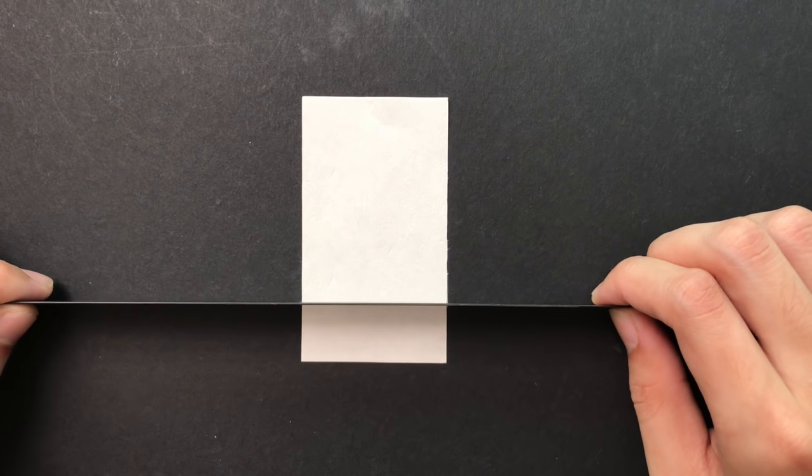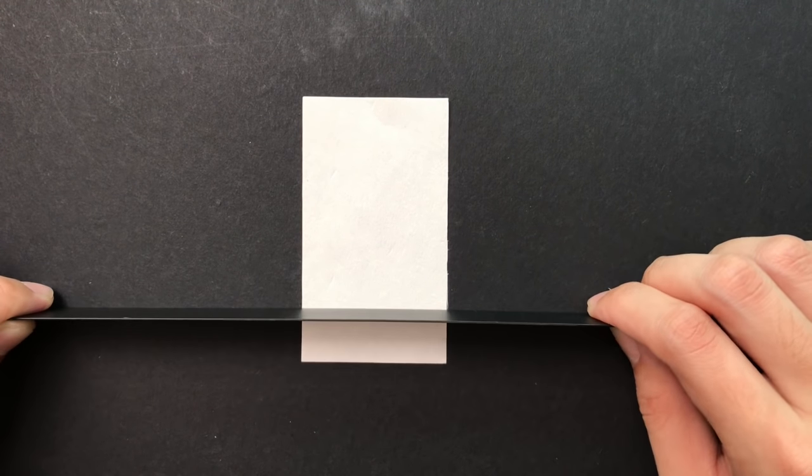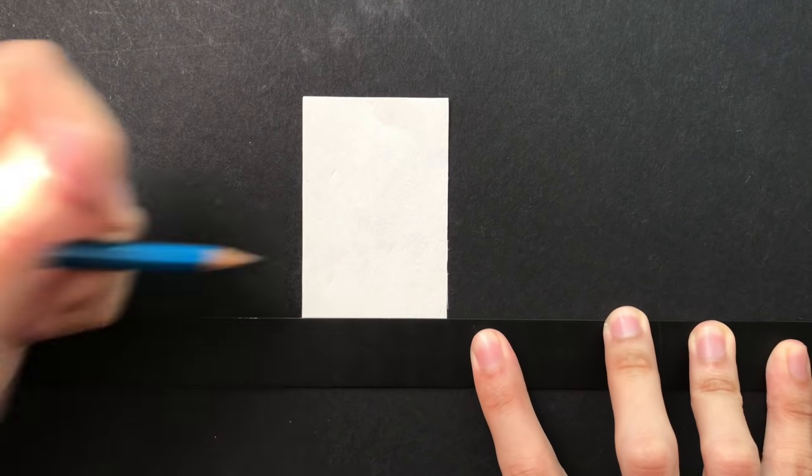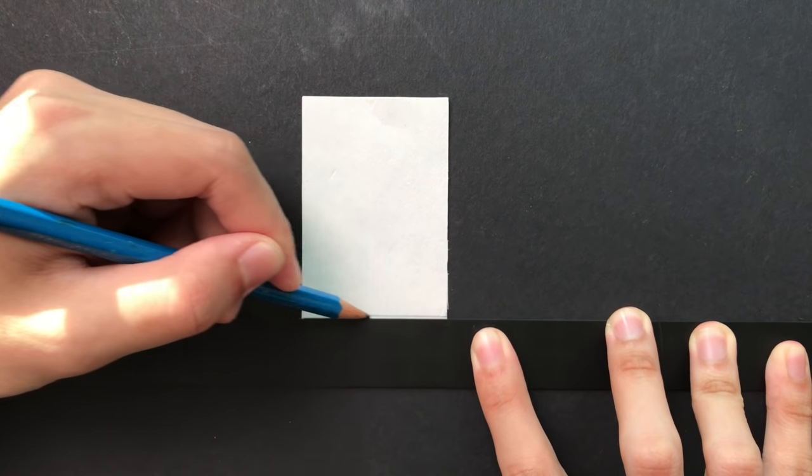Using a filter paper, we first draw a start line about 1.5 centimeters from the base using a pencil.